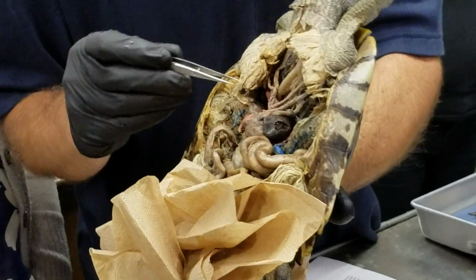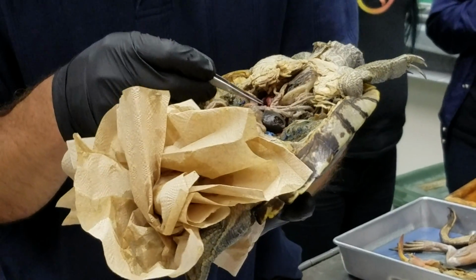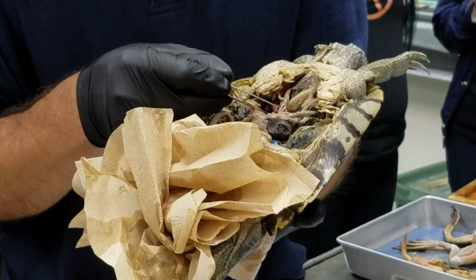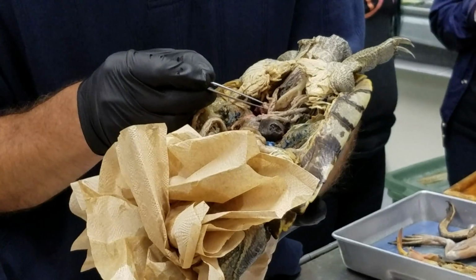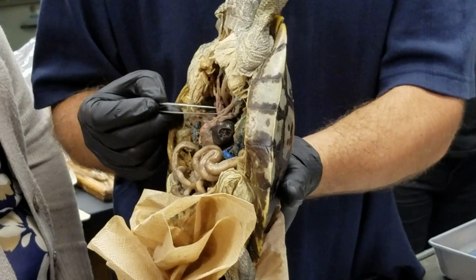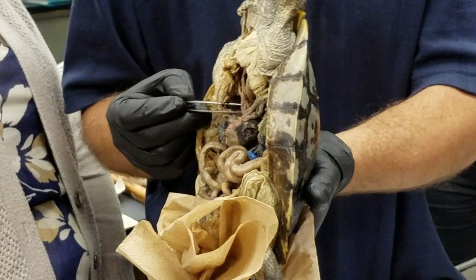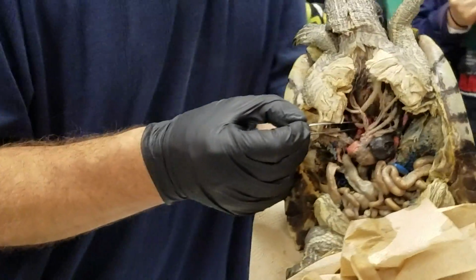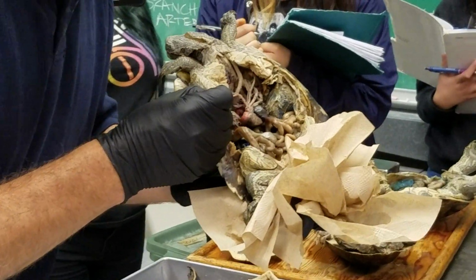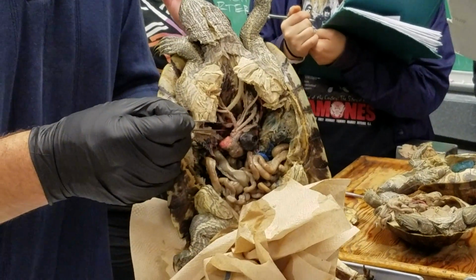Okay. Now, also then we have over here, or we did, if it hasn't been broken already. Yes, right here on the back side, this is the right systemic arch that also comes off that right systemic trunk along with the brachiocephalic. Okay, so that's this guy here. I'm not carrying it too much. That's the right systemic. Right systemic arch.